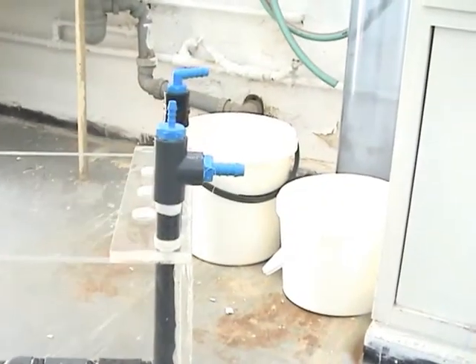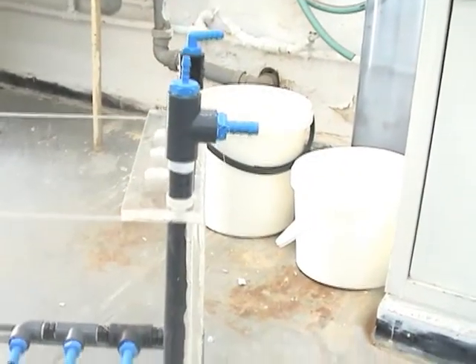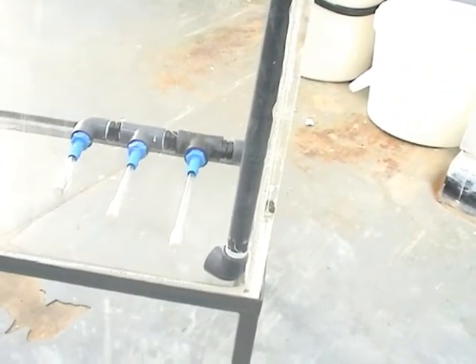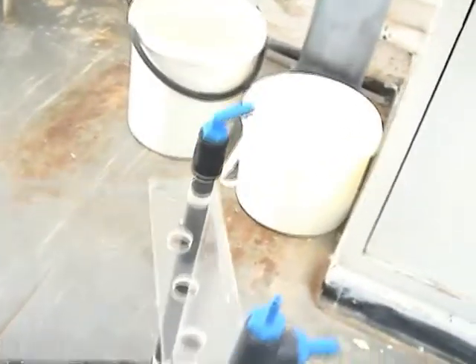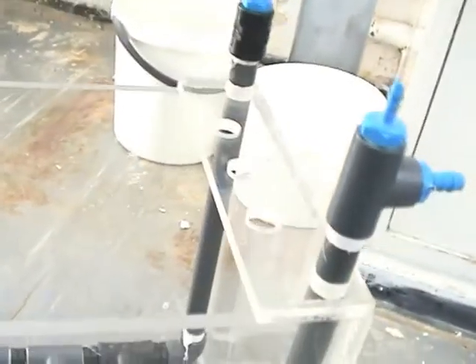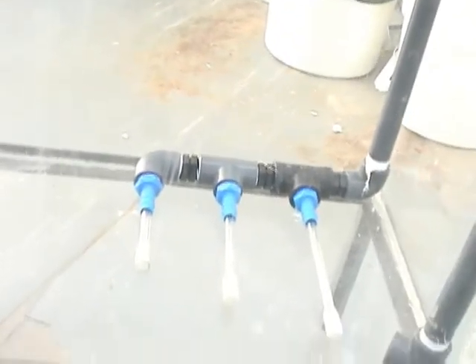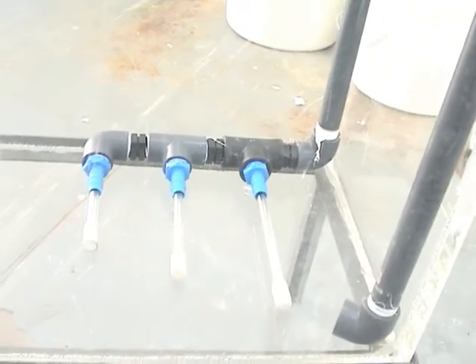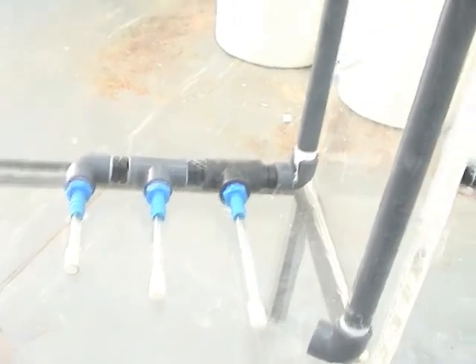This pipe here is the flow getting up to the bottom part of the reactor. And on the other corner we have another pipe that also goes to the bottom part of the reactor. In the bottom part of the reactor we have three air diffusers.